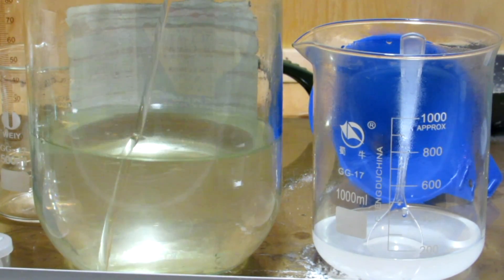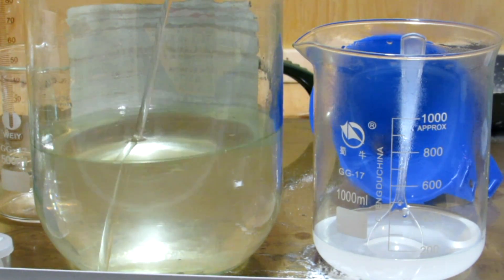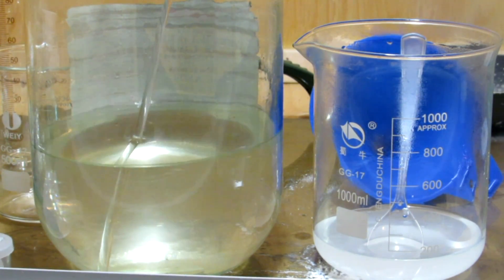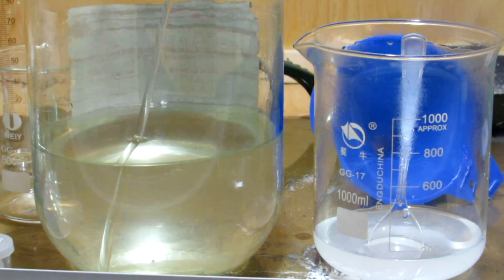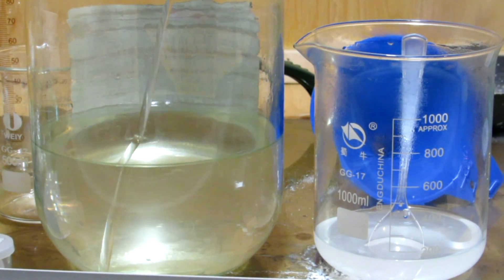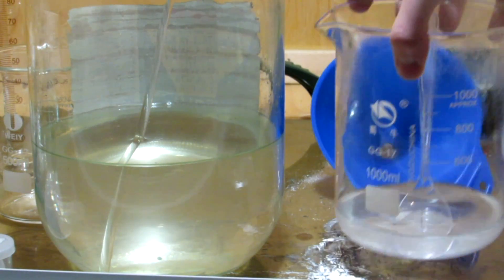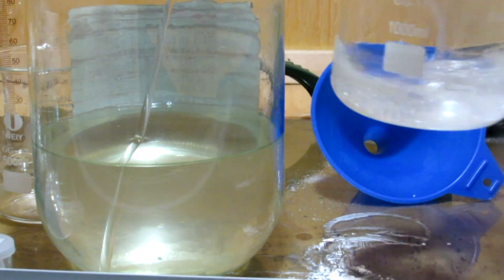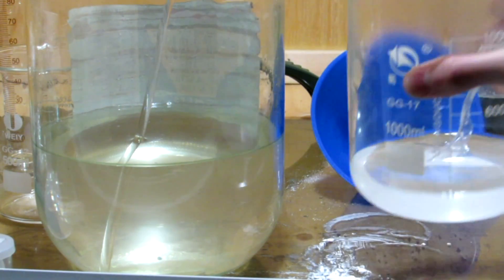Now we don't actually have this much sodium hydroxide because sodium hydroxide will absorb a little bit of water out of the air. However, having a slight excess of our phosphoric acid solution isn't a bad thing because we want to prevent the formation of disodium monohydrogen phosphate, which would form if we over-neutralize our phosphoric acid. So by having slightly less sodium hydroxide, we ensure only monosodium dihydrogen phosphate is formed.